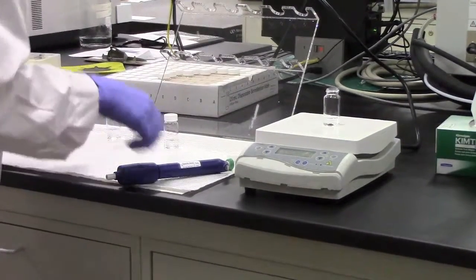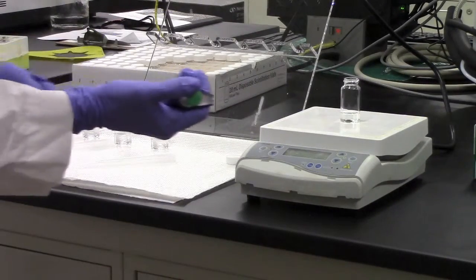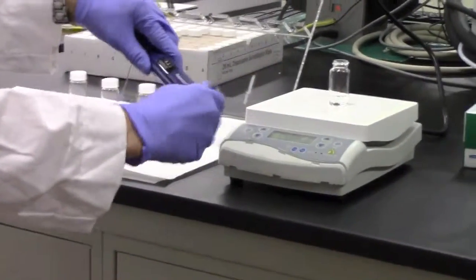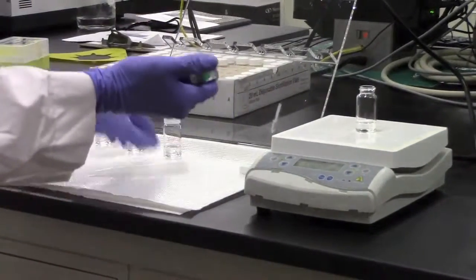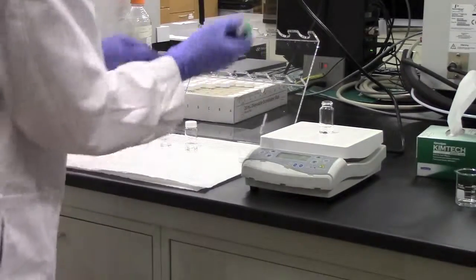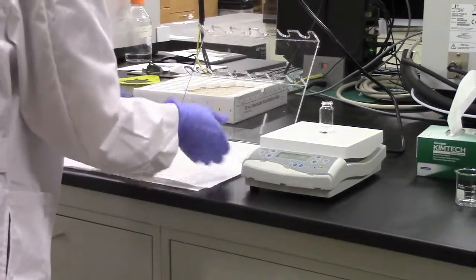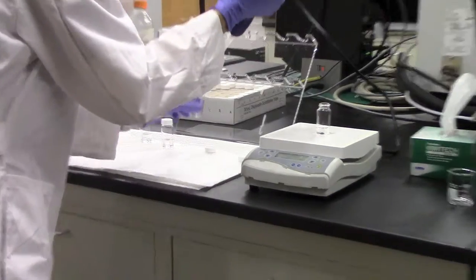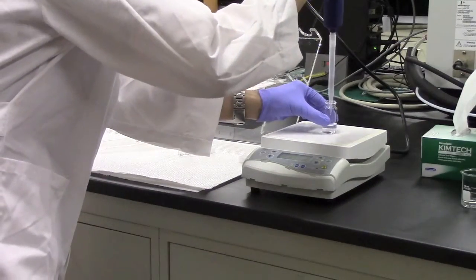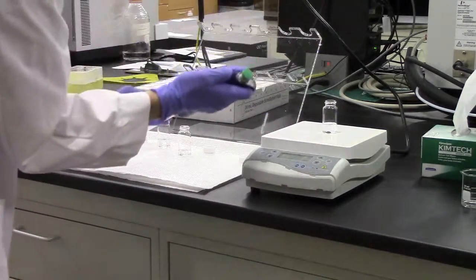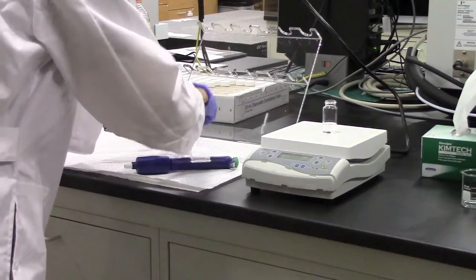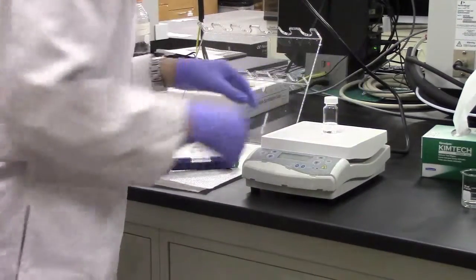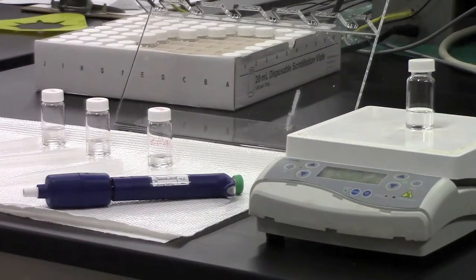Add in two milliliters of the zinc acetate solution. I'm going to lightly cap the solution while it warms up to the appropriate temperature. This should only take a couple of minutes.